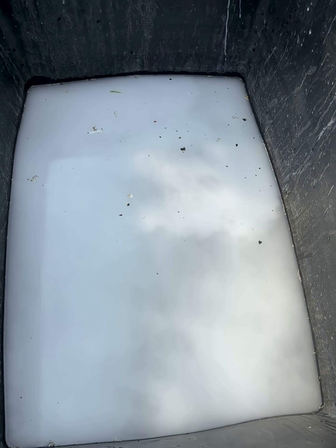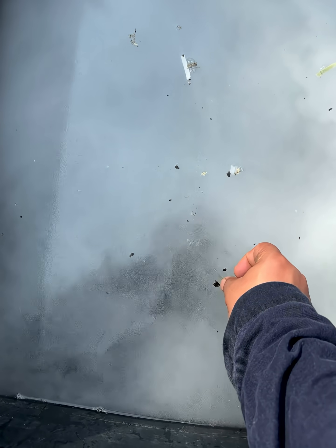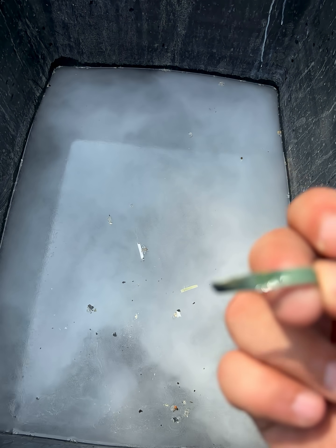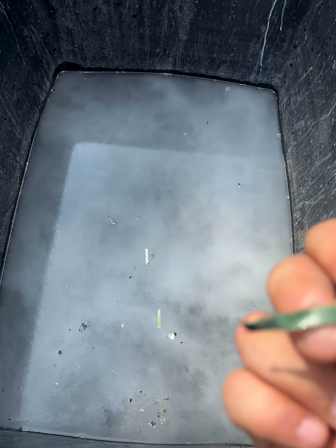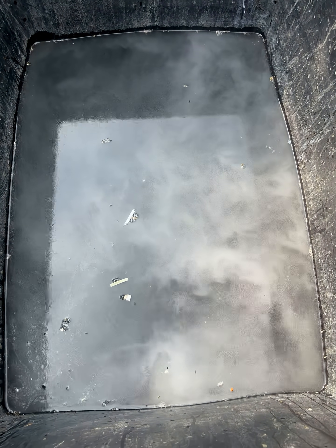It's going in the air, and this is producing a salt — sodium metaborate — that's like a neutral salt, though not completely neutral. I'm waiting for it to completely disappear in water. Let me pH the solution — this is a pH paper. Oh, that's absolutely green, that's a little bit caustic, around pH 9 to 10.